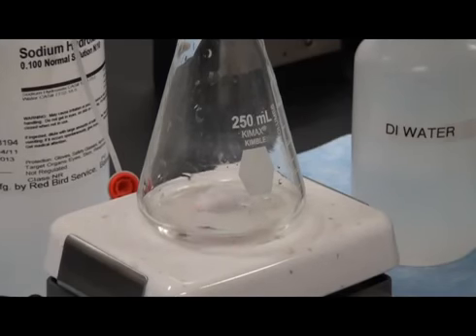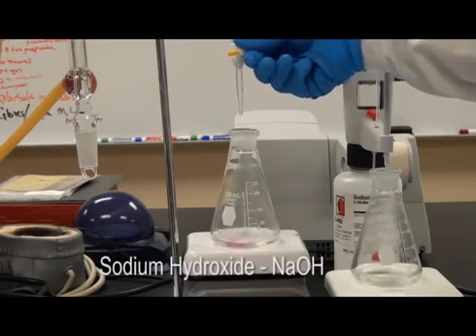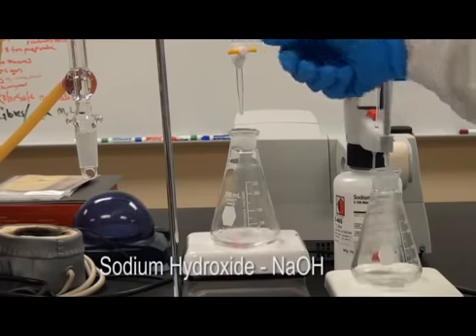The titratable acidity, or TA, of wine, or must, is determined by titration of a sample with a standardized solution of sodium hydroxide, NaOH.